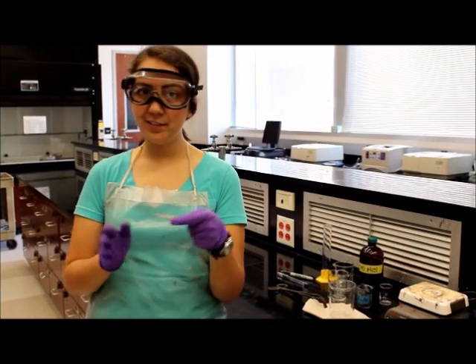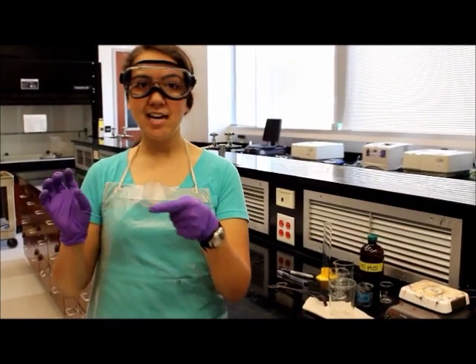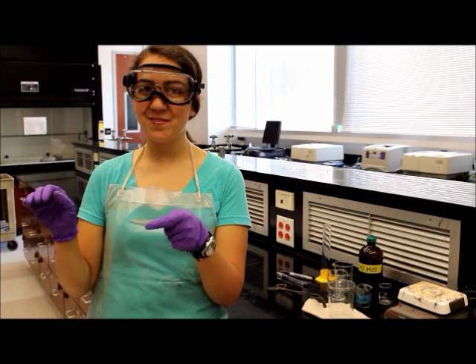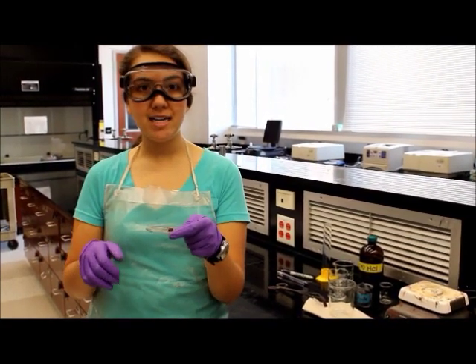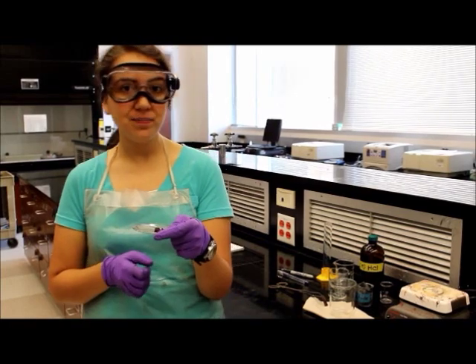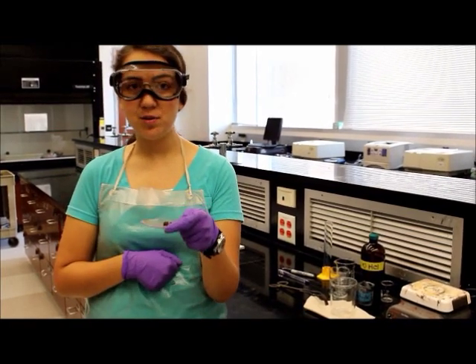Also, a helpful tip for that oven situation is to put it in the back of the oven as far away from the door as possible. I know the oven is actually really small but it will help stabilize the temperature and hopefully your sample will dry faster.